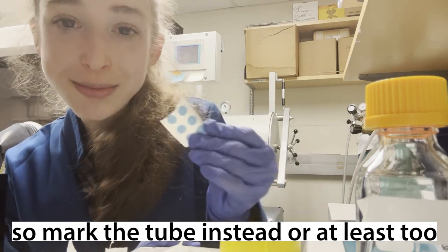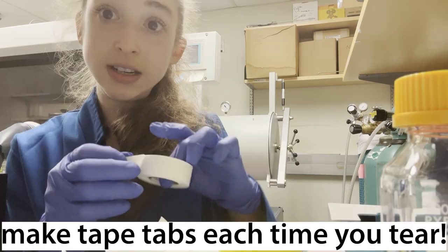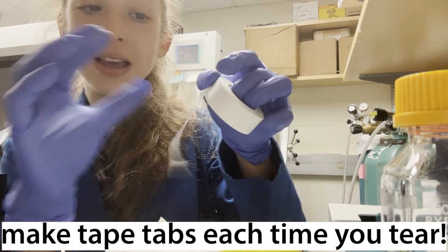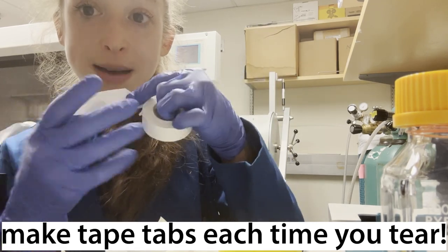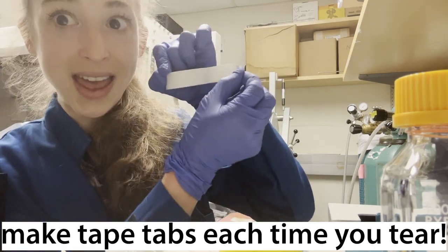Make sure that these labels stay on, but make sure that all temporary labels are going to come off. Just remember: every time you go to pull off a piece of tape, tab it over. Now you've got a tab on your label and you've got a tab to help you find the end next time.